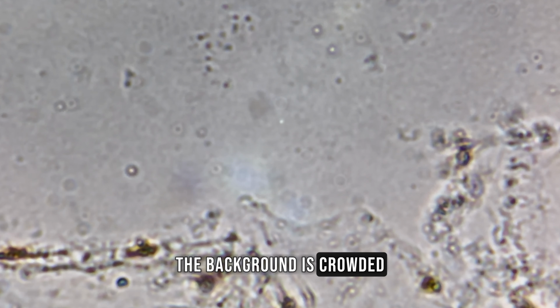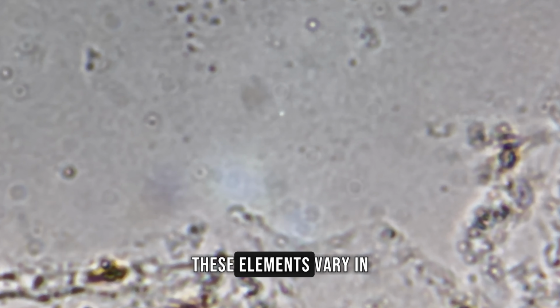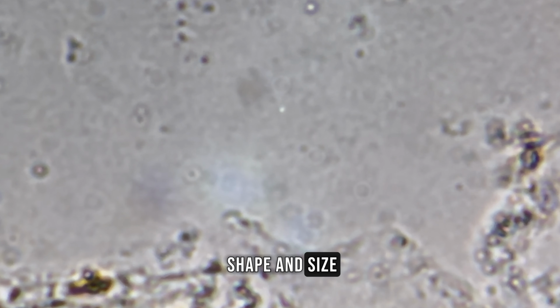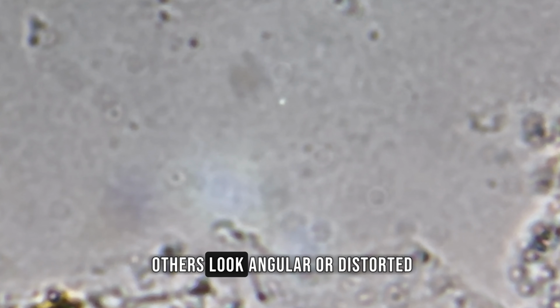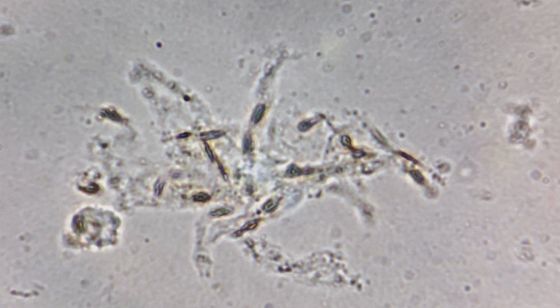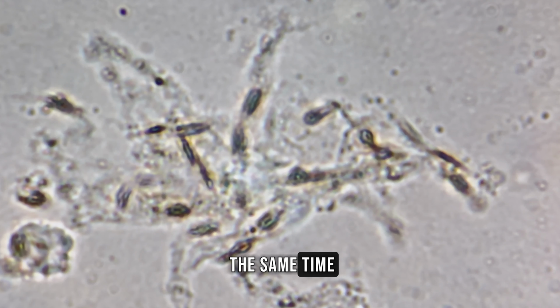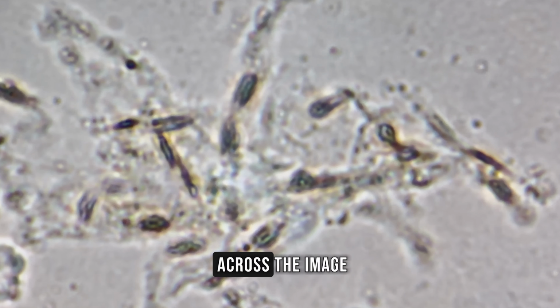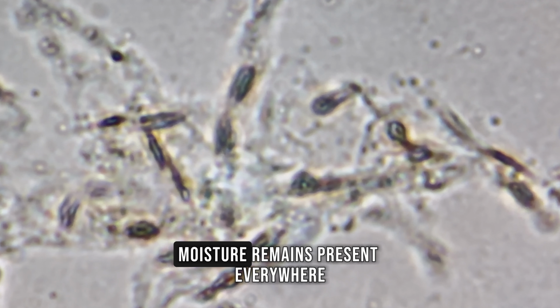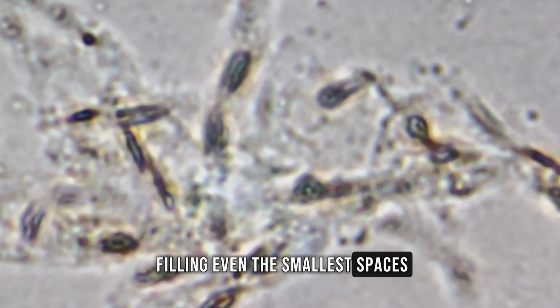The background is crowded with tiny particles and fragments. These elements vary in shape and size. Some appear rounded, while others look angular or distorted. The structure feels both organized and chaotic at the same time. Patterns emerge, then dissolve as the eye moves across the image. Moisture remains present everywhere, filling even the smallest spaces.